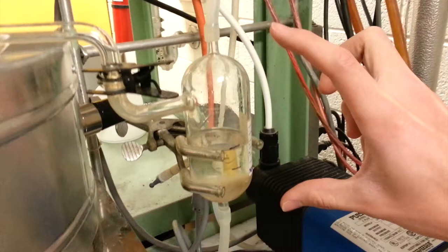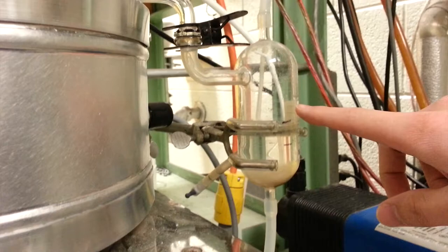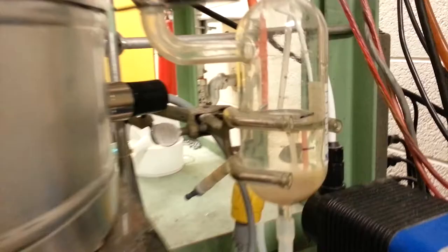This cylindrical glass vessel has the bottoms. There are two marker lines here, and those are important because to measure the bottoms flow rate, you need to turn up the pump over there to drain the bottoms until it gets below the line. Then stop the pump so it slowly fills up, and you time how long it takes to get from the bottom mark to the top mark. That gives you your volumetric flow rate because you know the volume of the cross section there.